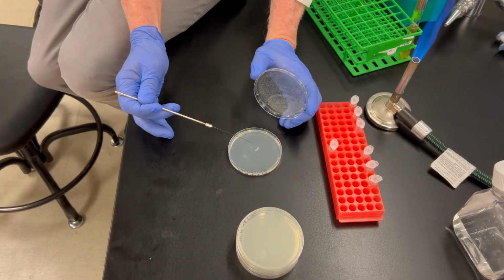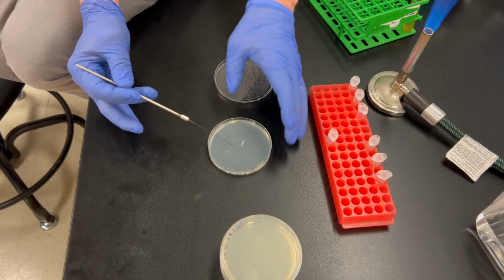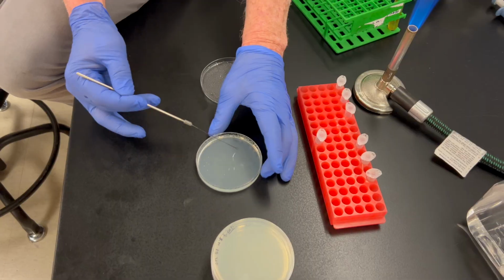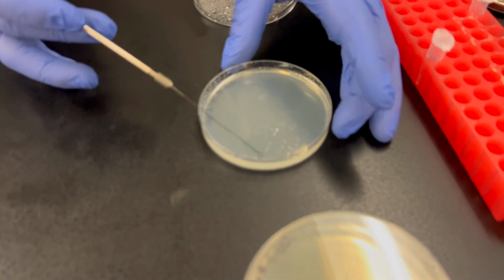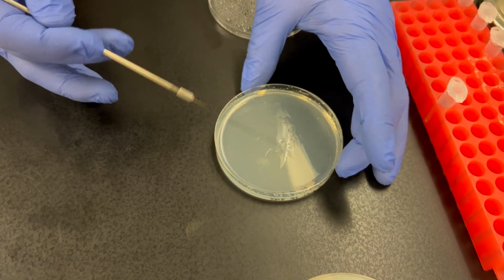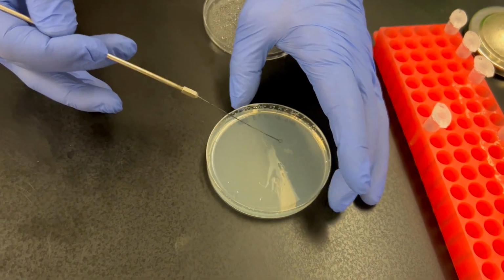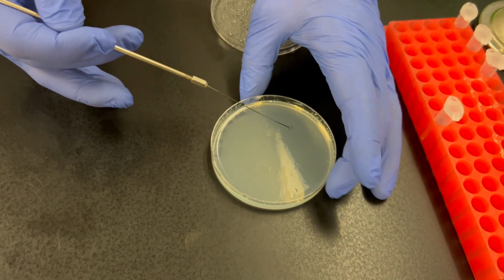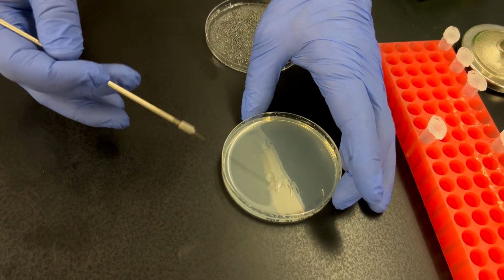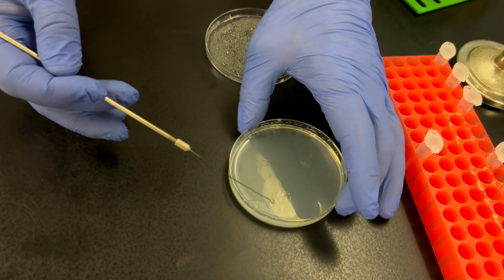In this case, I have a lot of solution in there, so I'll just go in and gently touch the solution. Now I want to get an even distribution of bacteria on this plate. So I'm just going to spin that with my left hand while I go back and forth with the loop across the plate, trying to get a really nice even distribution of bacteria across this plate. There are many ways to do this. You can do this with sterile beads, which is very good. You can do this with glass spreaders. This loop method works fine, and we can see what the results will be in a few minutes.